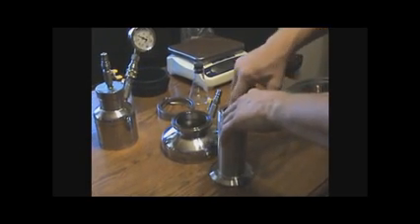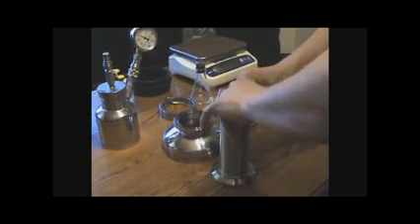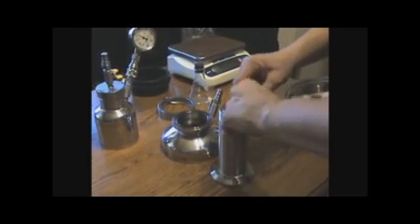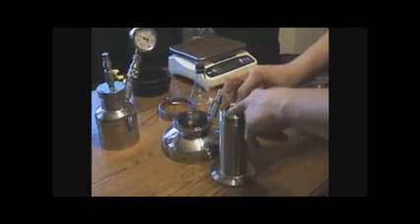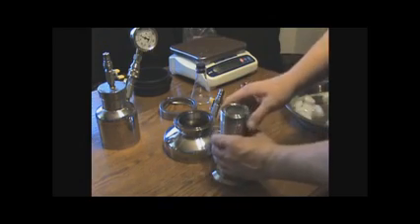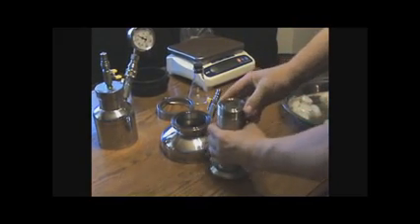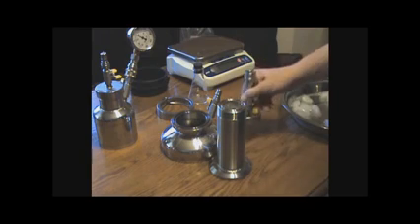I take this steel wool, roll it up into a ball, and shove it right into the top. Make sure no pieces of steel wool are laying over the side. If you're wondering why I'm using steel wool instead of some lab-grade filter, it's because I've used those before and this just works better. That seals this off so that you can blow this out.